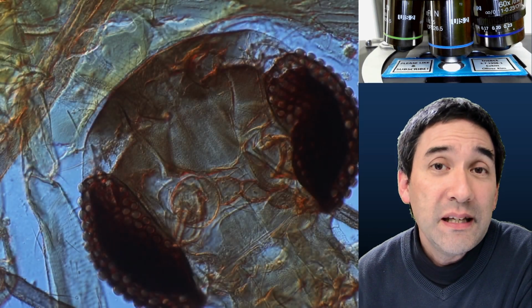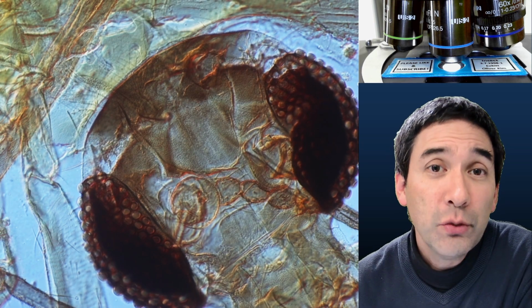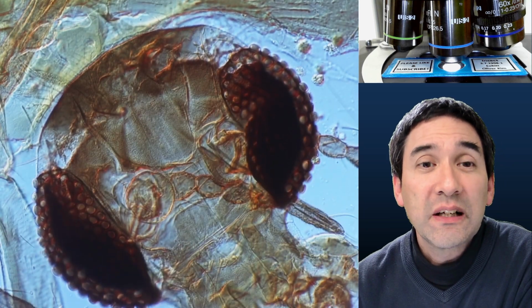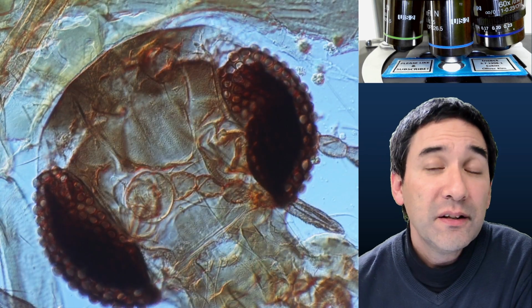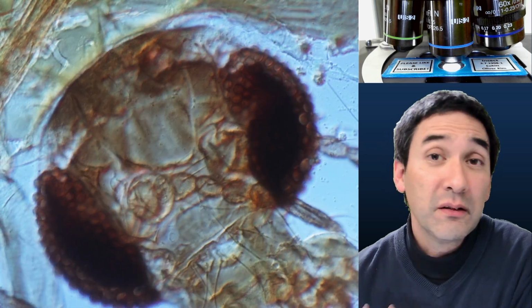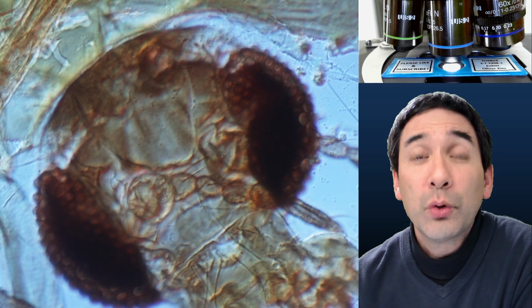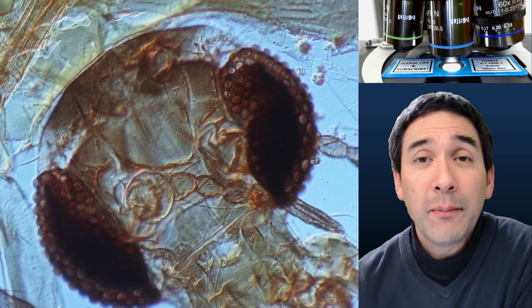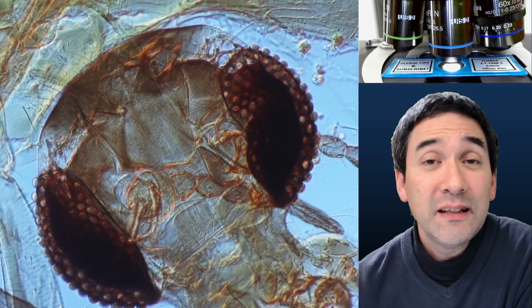And Euparal is very much liked by people who are studying insects because it has one main advantage, and that is it starts to clear the specimen. There is a so-called clearing action. So the insects or little spiders or whatever you want to mount become more and more transparent over time. The mounting medium bleaches the insect somehow, and this makes it brighter and easier to observe.